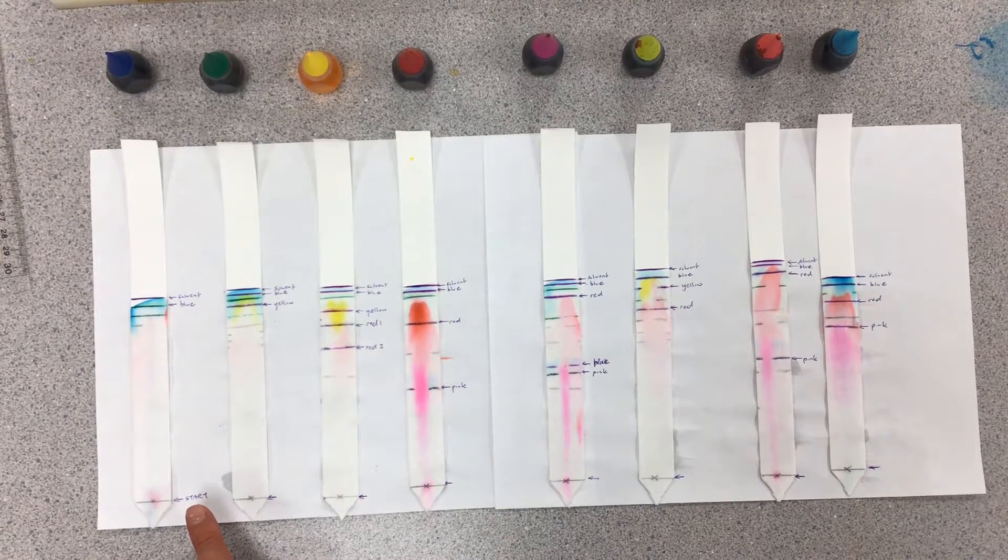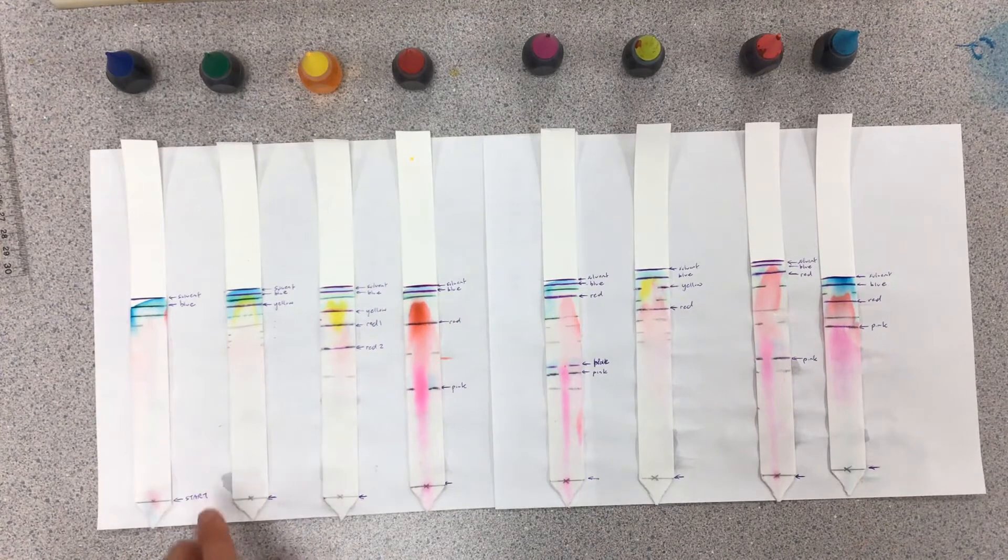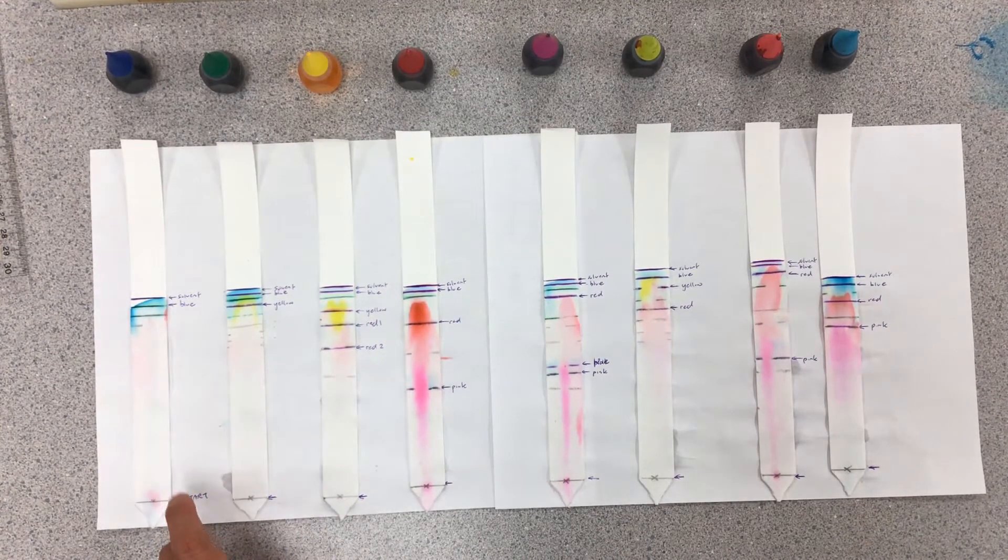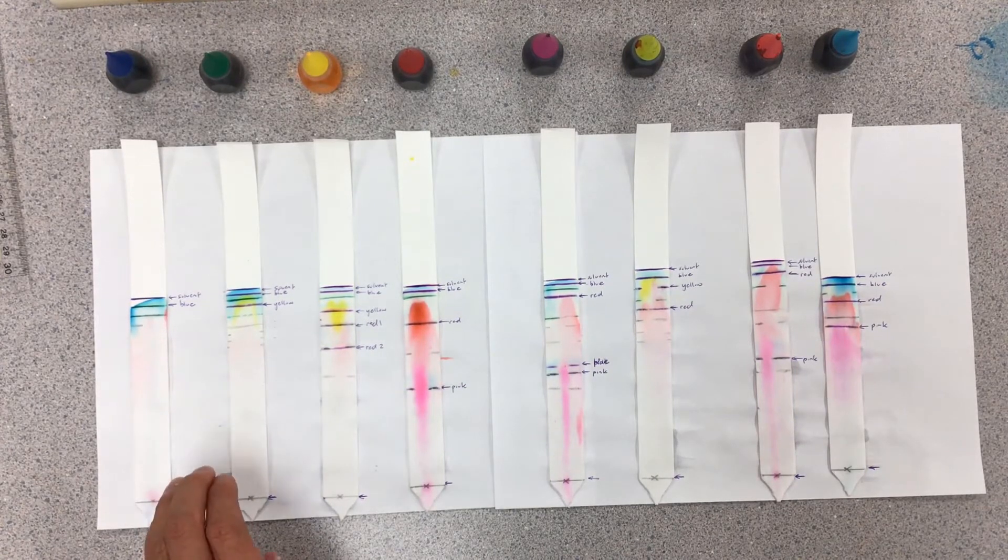Depending on the chemical composition of the mixture itself, it's been climbing with the water. If it's very soluble in the water, it climbs pretty neck and neck with it. If it drags its feet, it's a little bit slower to begin with. Over time, think of it as a race.